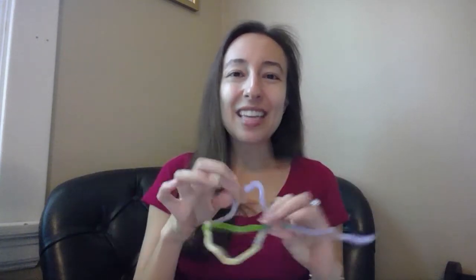Now, kind of an interesting note, if you guys don't know this, I've always wondered why it turns white. Okay, so certainly you're breaking apart some protein structure, but why does it turn white? It actually turns white because when you break apart those polypeptide chains, they tangle up in ways that they're not normally tangled.